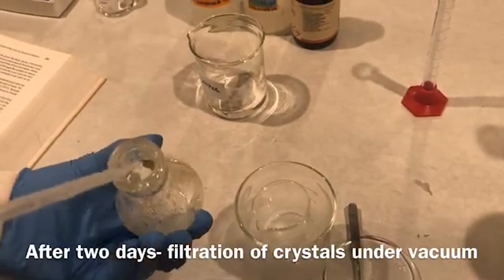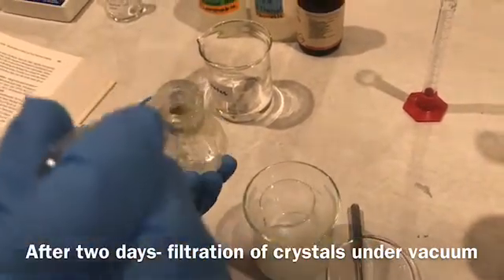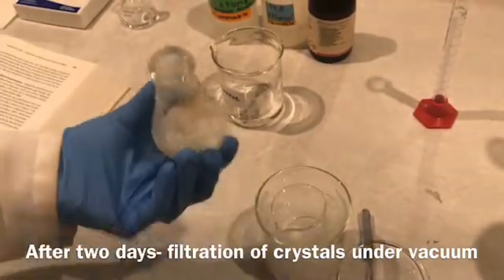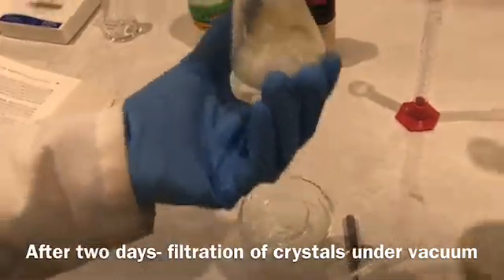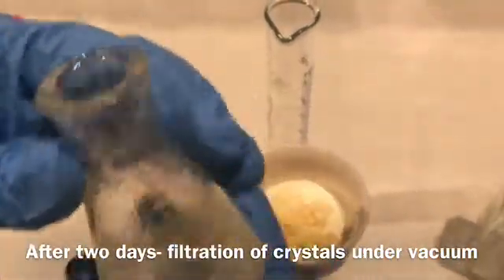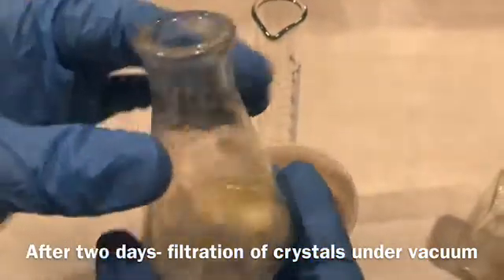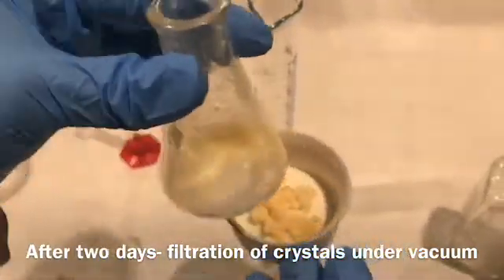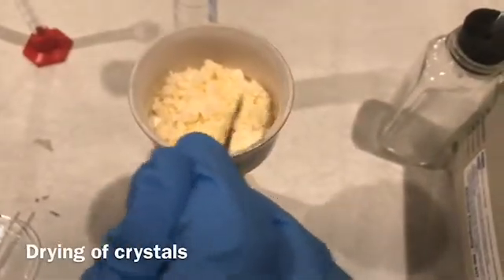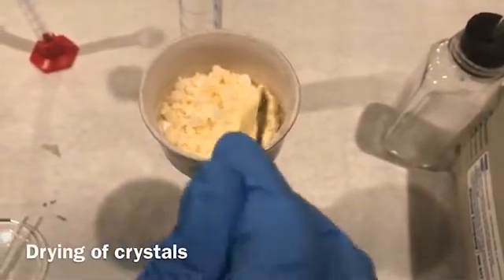I am going to wash the crystals with the chilled DI water in two portions of 5 milliliters each. I have now washed the crystals with 5 milliliters of chilled DI water two times.